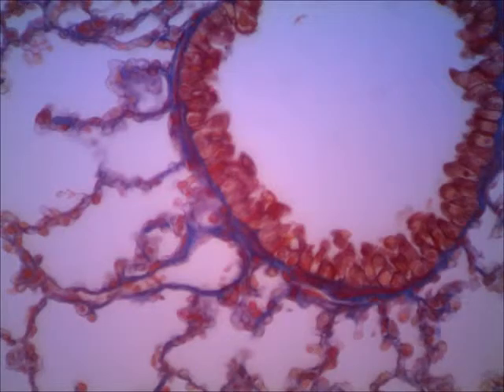All right, now my last slide. The bronchiole is very, very obvious. Here you see it. All this is the bronchiole. See what I mean by a thick, wavy lining? And these are cells that are piled on top of each other. Whereas, if I erase those, here you can see the alveoli.